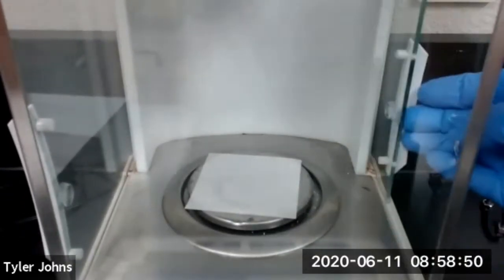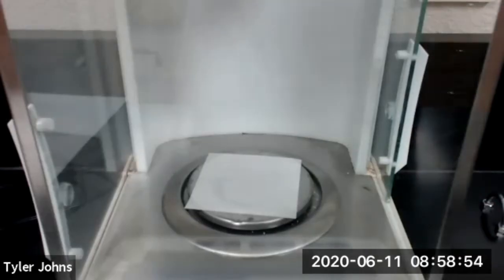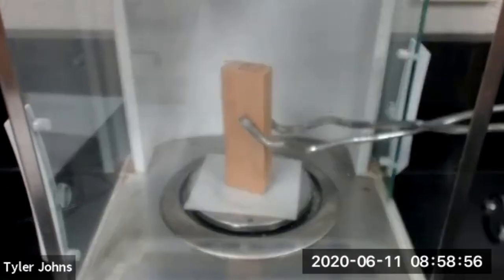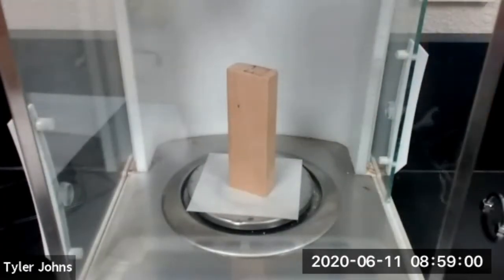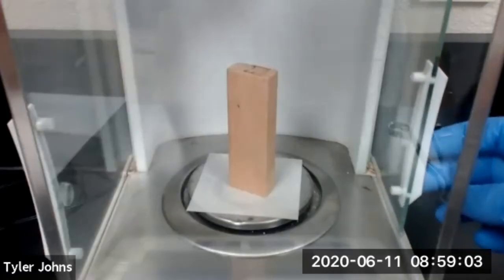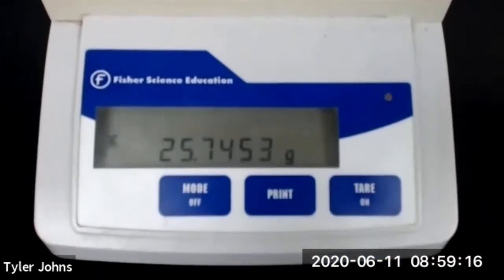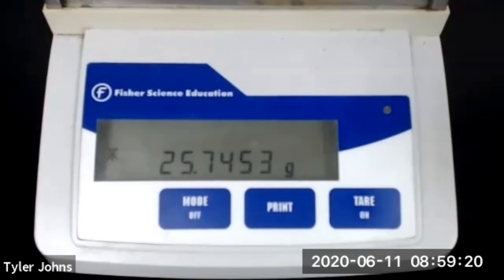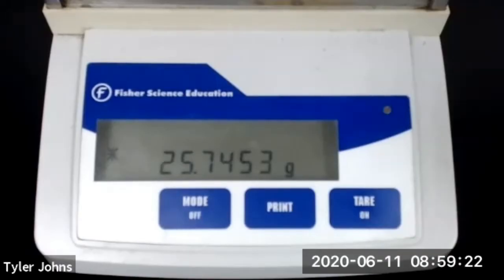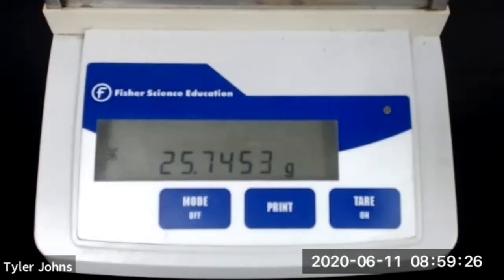We're now going to add our wooden block to the balance and determine the mass of just the wooden block. The mass of the wooden block, object number one, is 25.7453 grams.